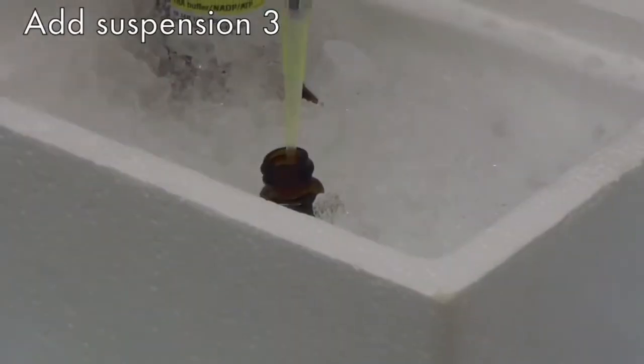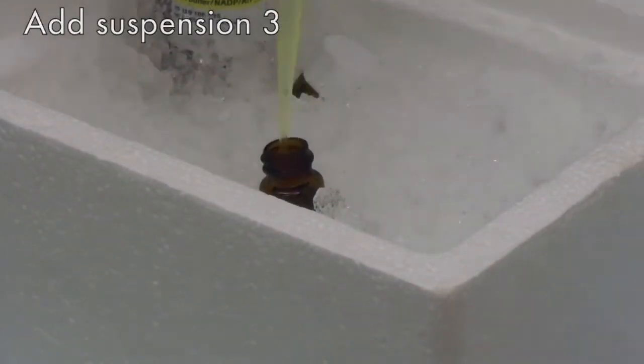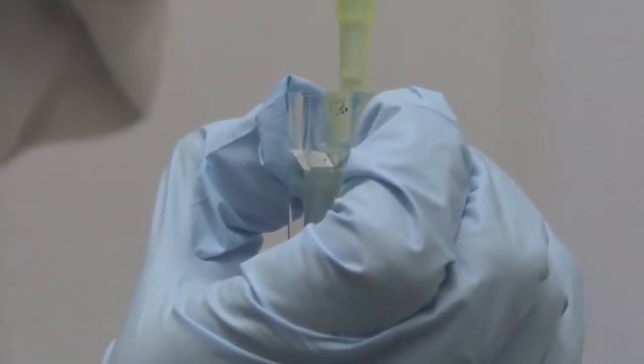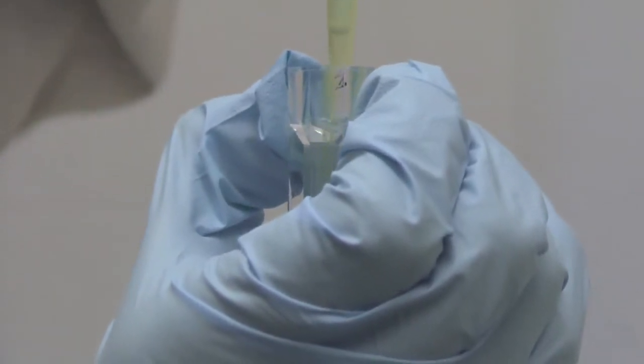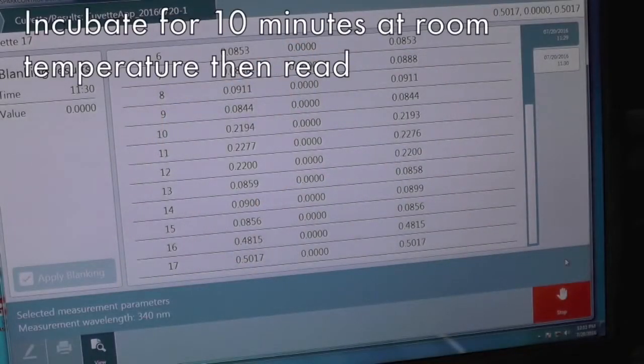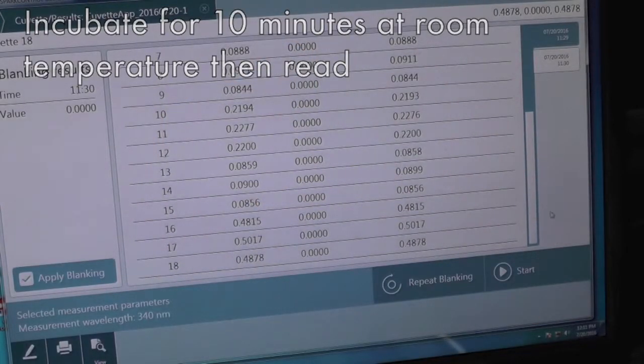Finally, add the proper amount of suspension 3 directly into the cuvette and mix by pipetting up and down. Incubate for another 10 minutes before reading the absorbance.